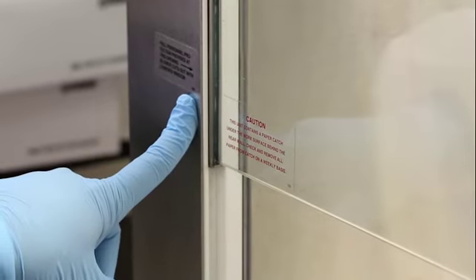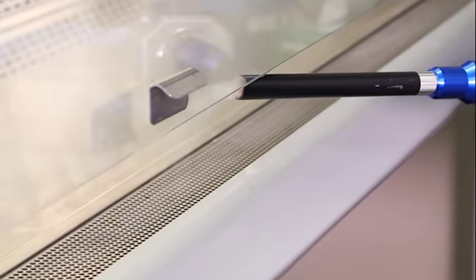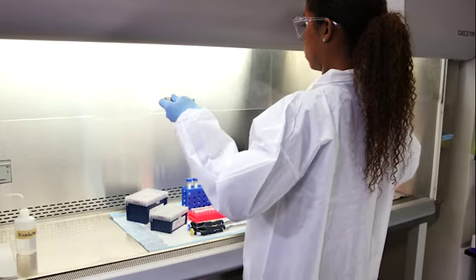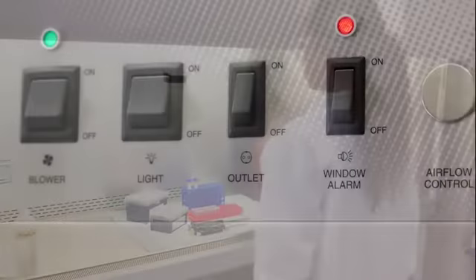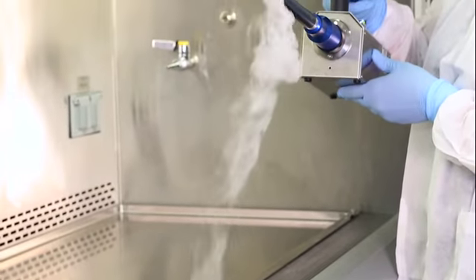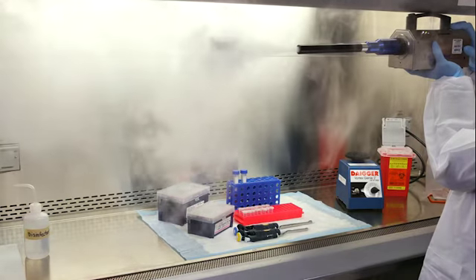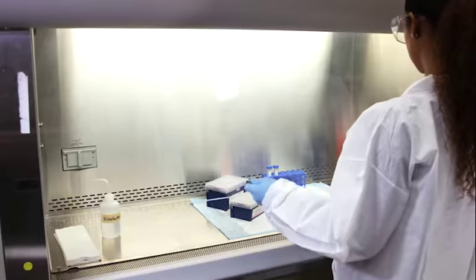If the sash is too low, inward air velocity will increase at the opening, which can cause turbulence and potential contamination inside the cabinet. If the sash is set too high, an alarm will sound. This indicates the inward air velocity may slow down to a point that it cannot provide and maintain containment at the sash opening. This could cause contaminated air to leak out of the cabinet or room air to enter the BSC opening, mix with the downflow air, and potentially contaminate the work product.